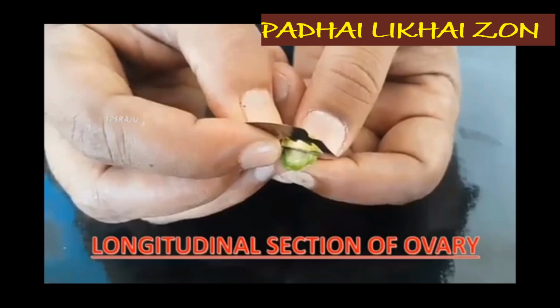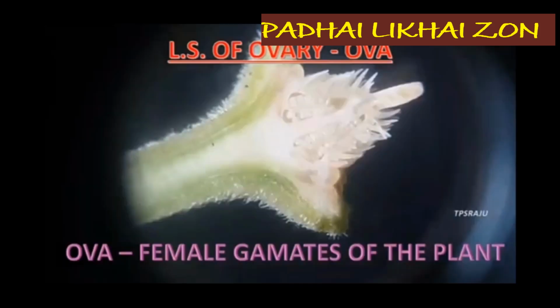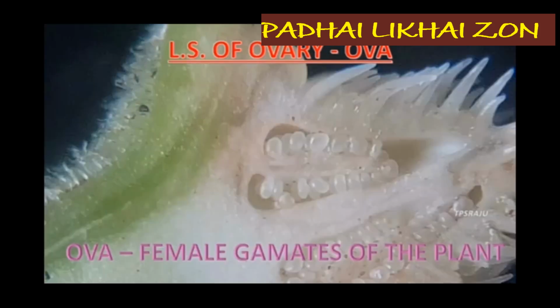Children, this is the longitudinal section of ovary to observe under the microscope. So this is the longitudinal section, that is LS, of ovary under the microscope. So these are ova, female gametes of the plant. And children, now this is the TS of ovary, transverse section of ovary, and again there are ova. So these are the ova.